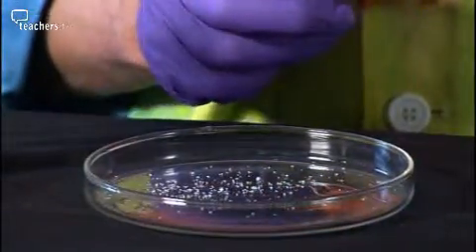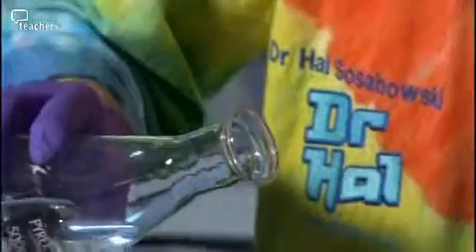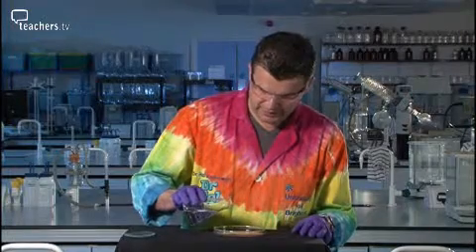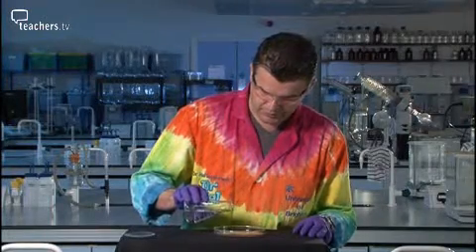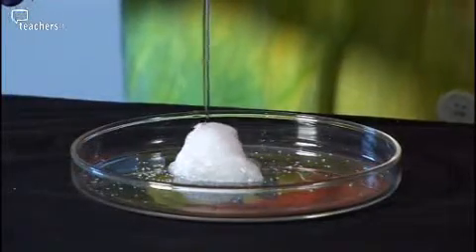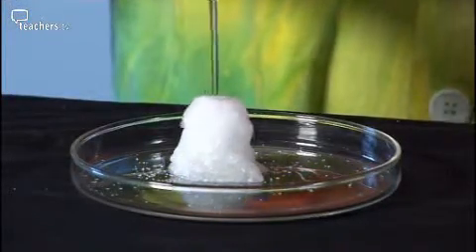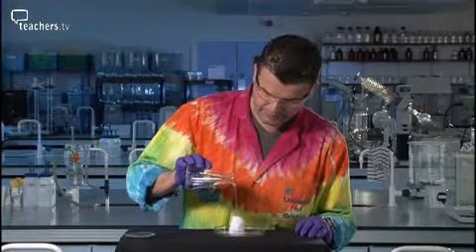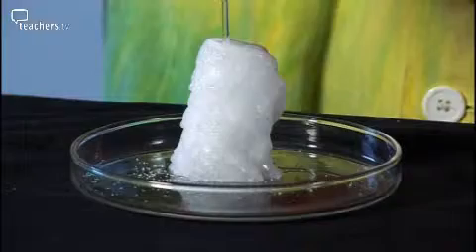Once it starts crystallizing out, you can't stop it. You start by pouring just enough onto one of the crystals to cause precipitation. As soon as that happens, the stalagmite begins to form, and we pull the pouring hand away to give it some time to breathe.